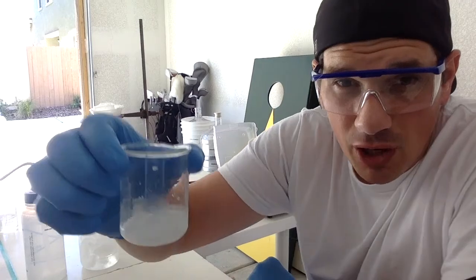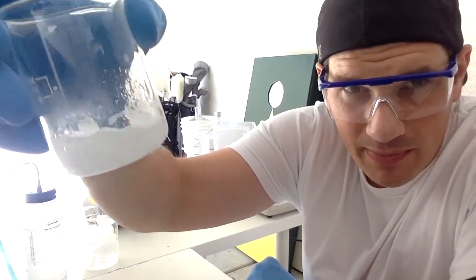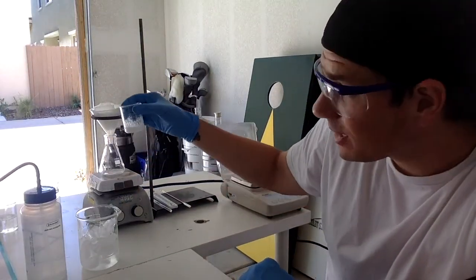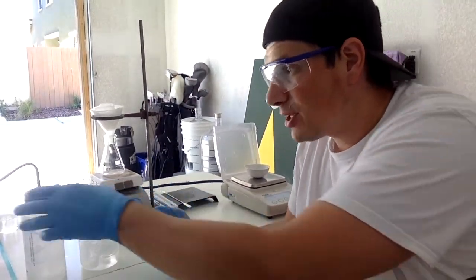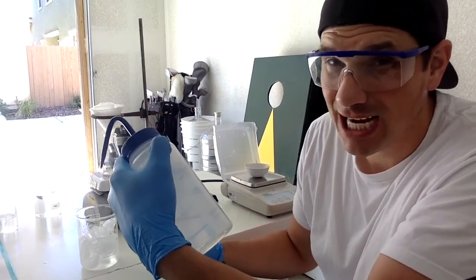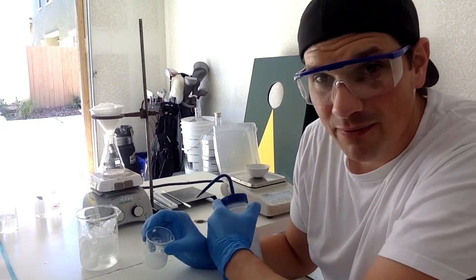And we're back. So I don't know if you can see it, but look at all those crystals up in there. That is the aspirin that we made. Just took it right off of the ice bath. Now I'm going to take this solution and filter it through my funnel and filter paper. Then I'm going to use my squirt bottle to get all the rest of the aspirin that's in there, because I want a good measurement of how much aspirin I have. Try to get it all out of the beaker, down into the flask and the filtrate.